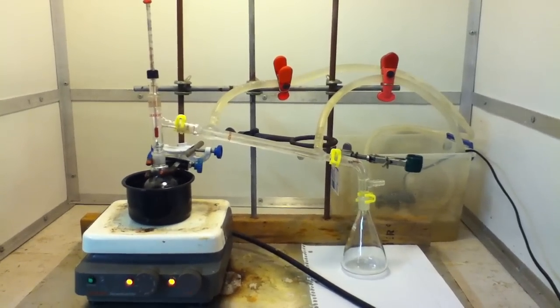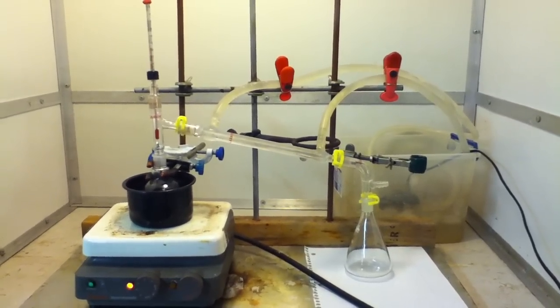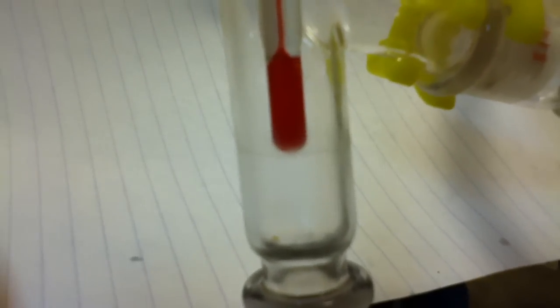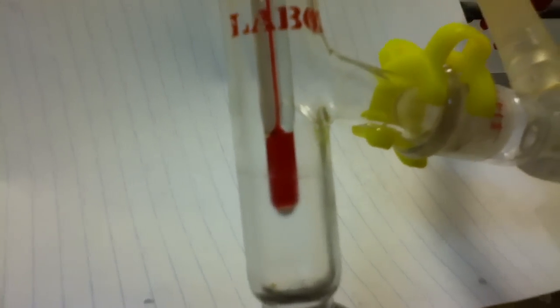Heat the oil bath and turn on magnetic stirring. Then, add ice water to your pump. Here you can see the condensation front climbing the apparatus. Collect the distillate from 60 to 64 degrees Celsius.